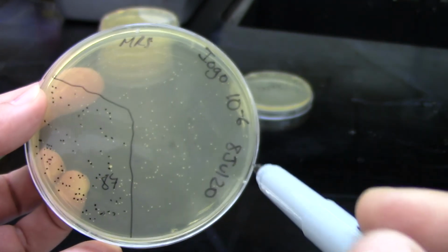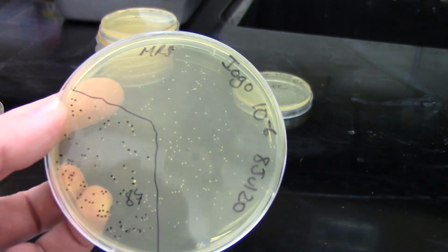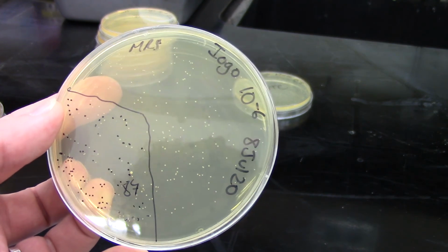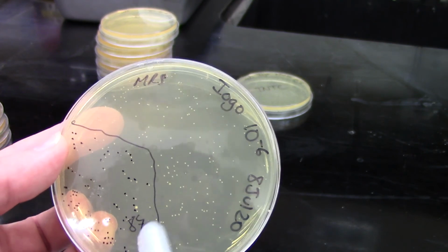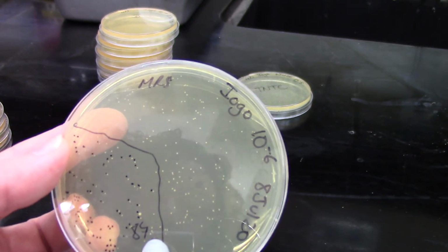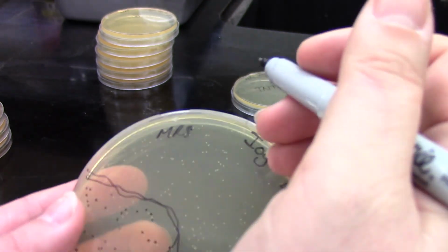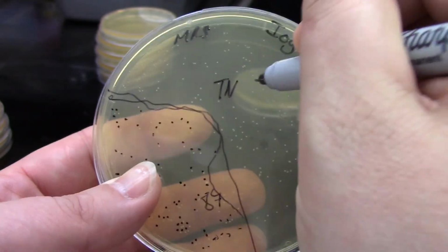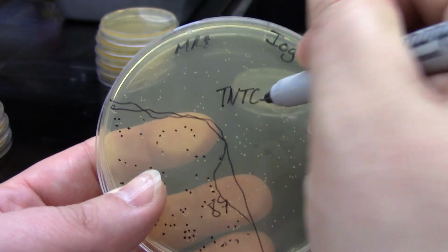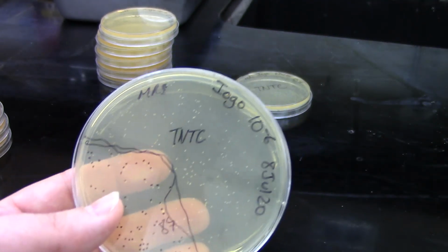just in this one small, about a third of the plate, maybe even a little bit less than that. So since I've already gotten up to that number and I still have so many more colonies left to count, I can already say that this plate is going to be too numerous to count. So we'll just give this guy a TNTC, because it is definitely going to be more than 250 colonies on that plate.